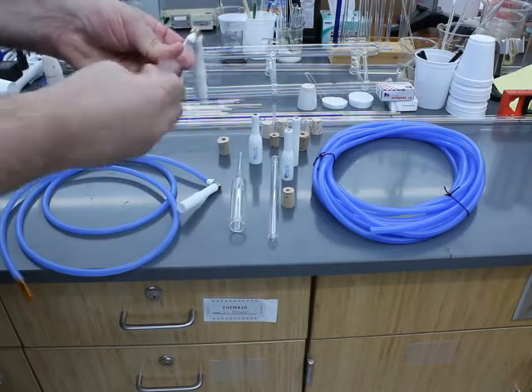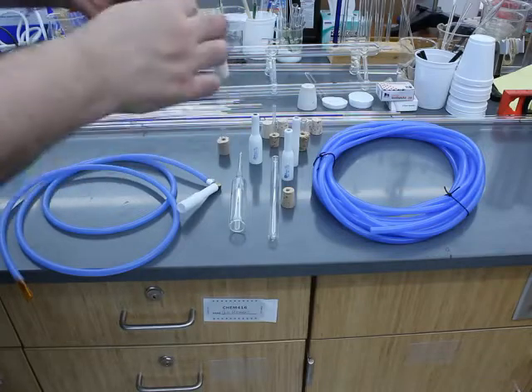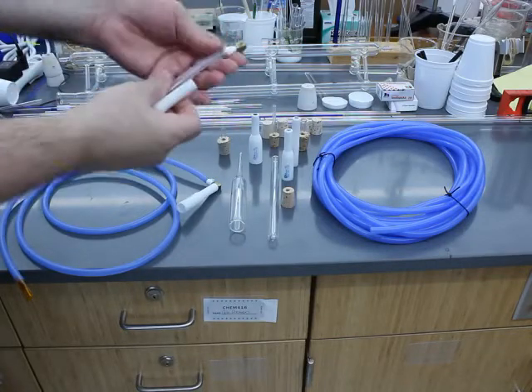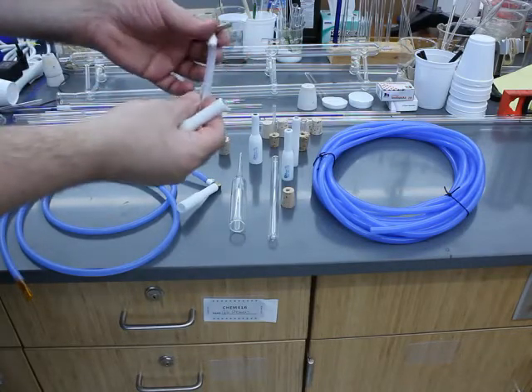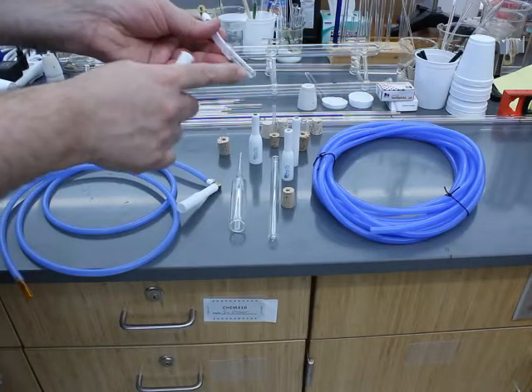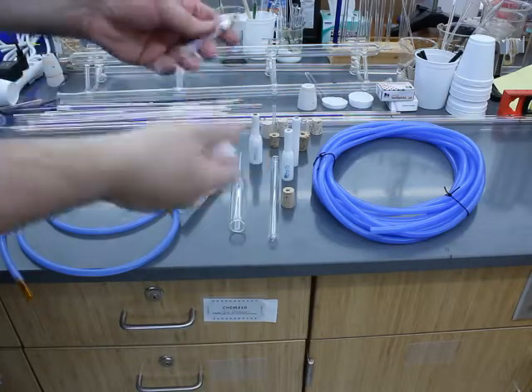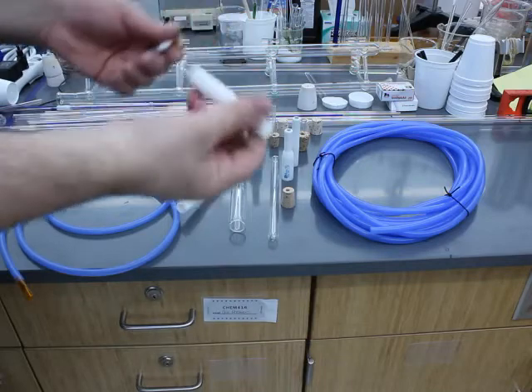For my students, because they need to share the adapters, I've got the swivel attached to a small piece of silicone and then I have a piece of glass tubing and then that will fit onto their blow hose.